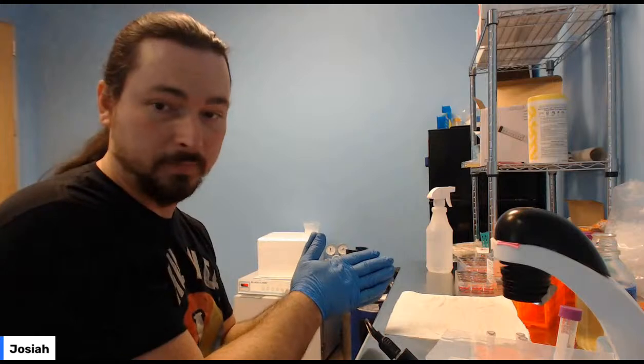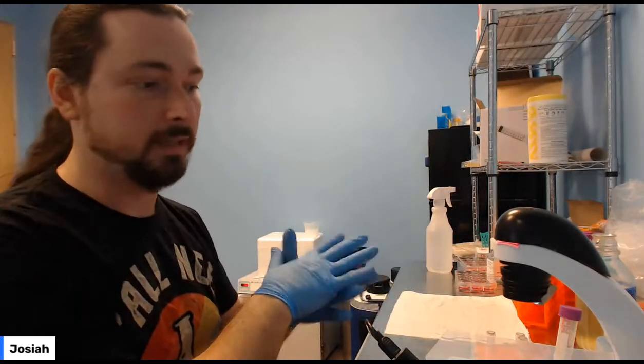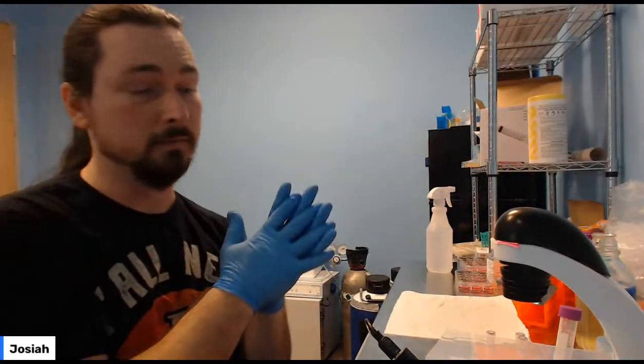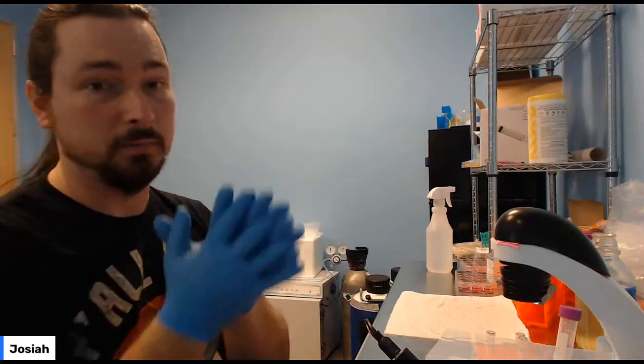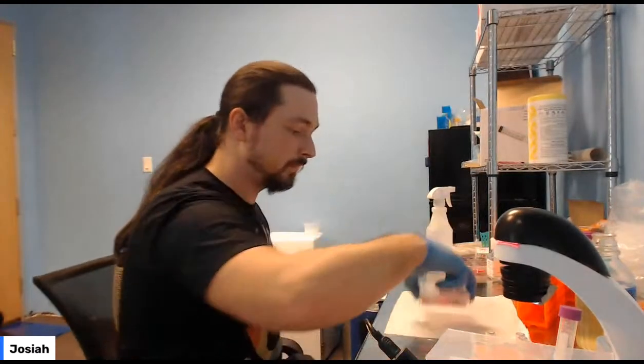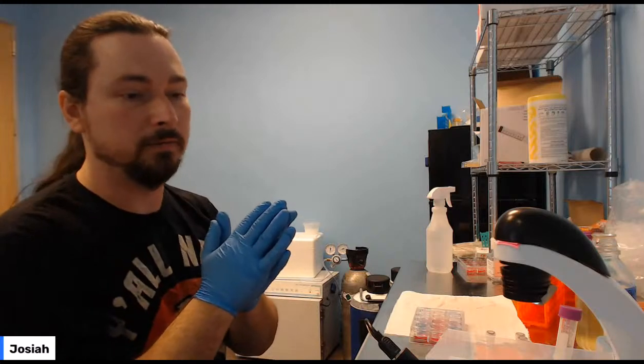So you'll seed your plate, let the cells attach, grow, and proliferate, and then when they're about 70%, which depending on how many cells you start with, could be the next day or a few days later. So the first step, I've got this plate, I've got a whole row. You only really need one row. You're going to see 12 wells, but you only really need 4. So look through the microscope, find 4 wells that are in good shape.